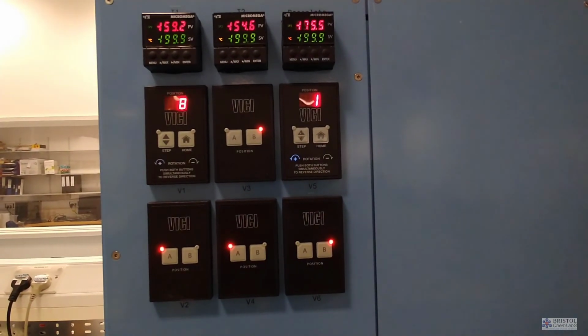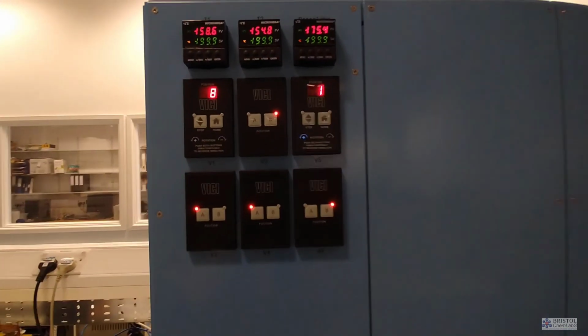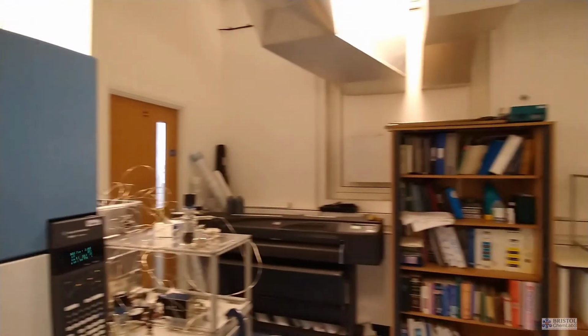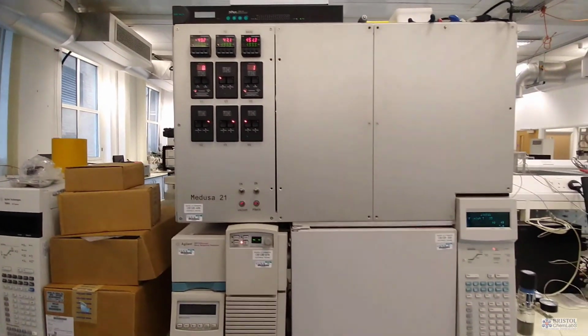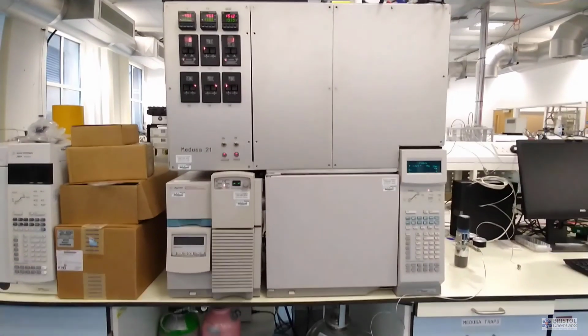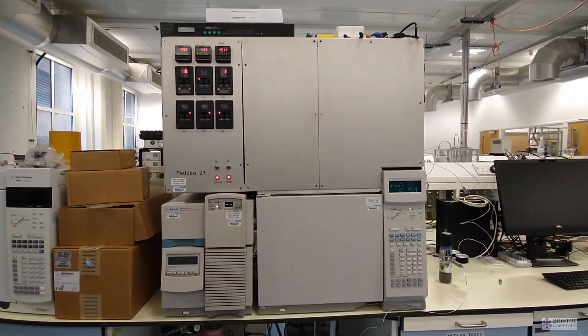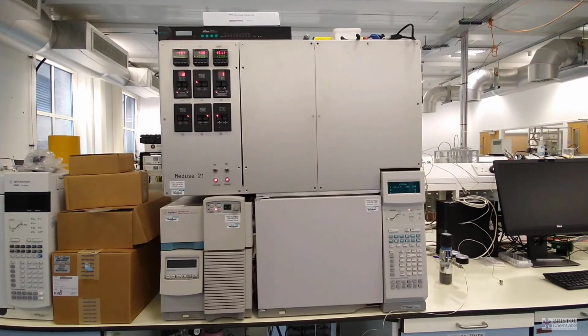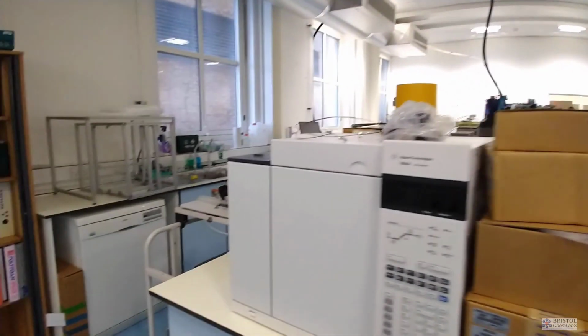And it doesn't just measure 1 or 2 compounds, but it measures 50 compounds at once. And it also measures to much, much lower concentrations. While the optical instrument before could measure 1 drop in a swimming pool, this one can measure 1 drop in 10,000 swimming pools.